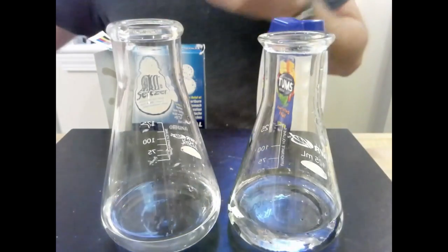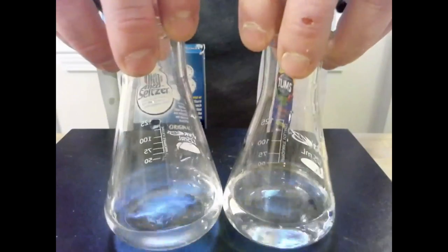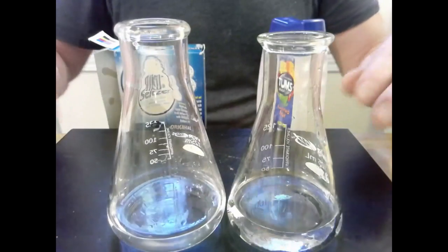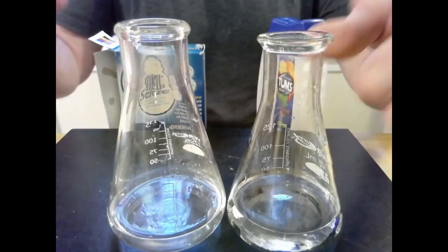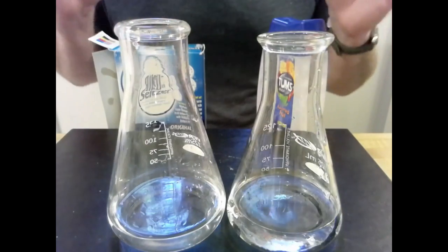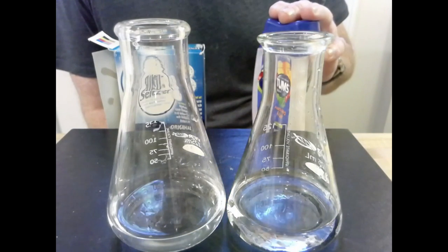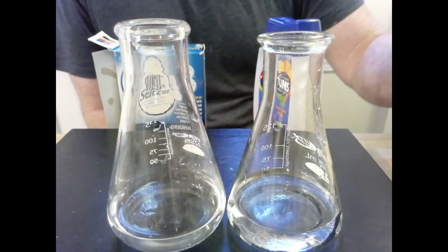So, essentially, what we've got here is distilled water with hydrochloric acid in a small dose concentration, which would represent your stomach acid at this point. Now, what we're going to do is to introduce each of these so that we can see the same reaction. Now, you have to remember, these are chewables, and they're designed to be crunched up inside of your mouth before you ingest them into your stomach.